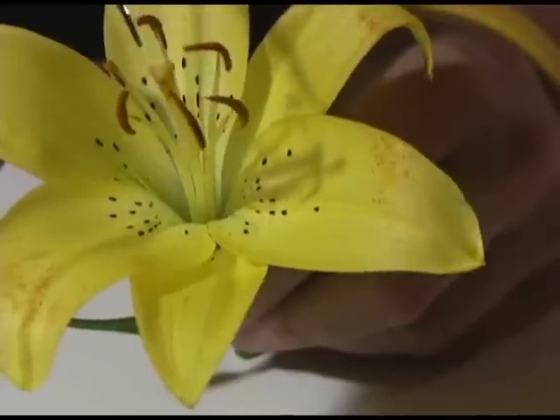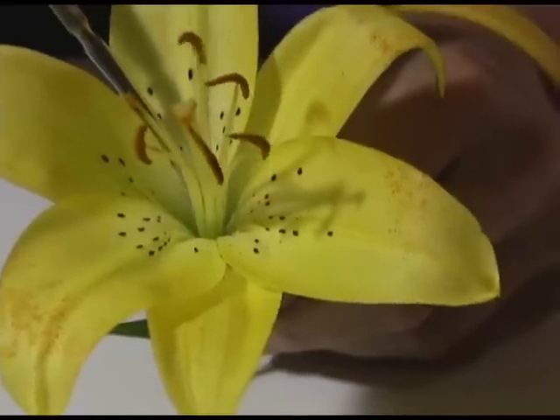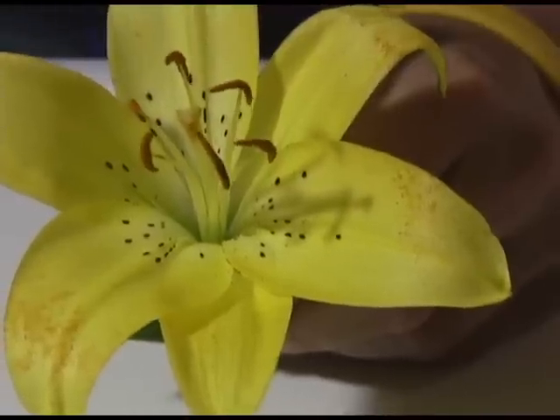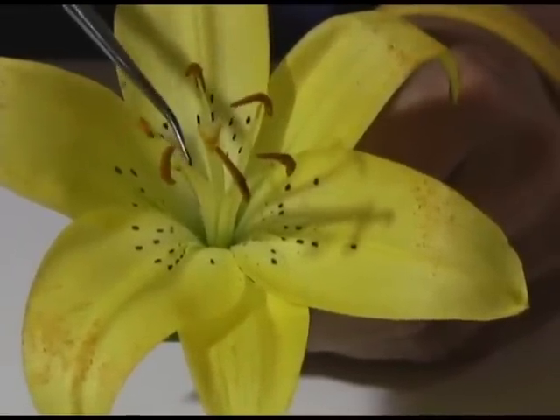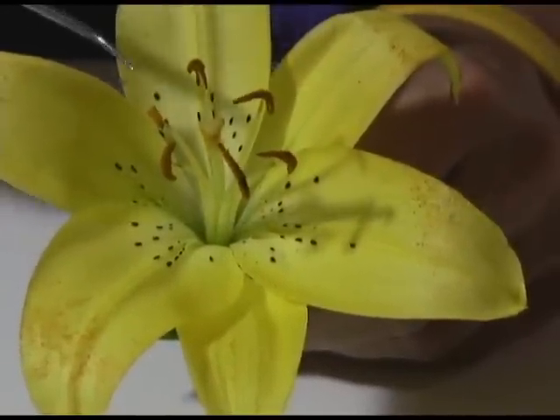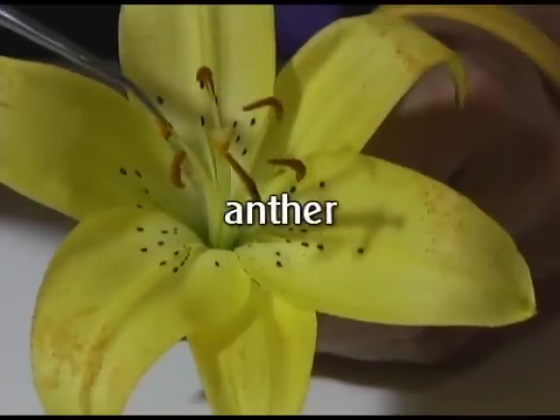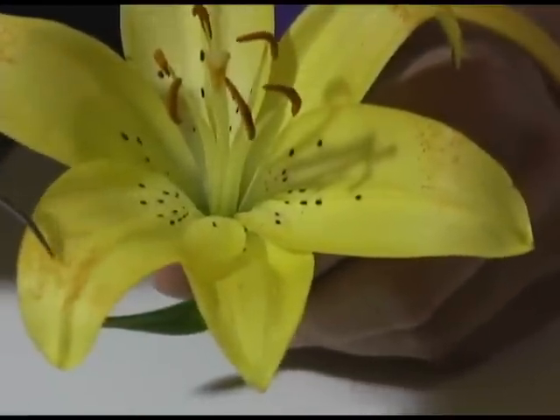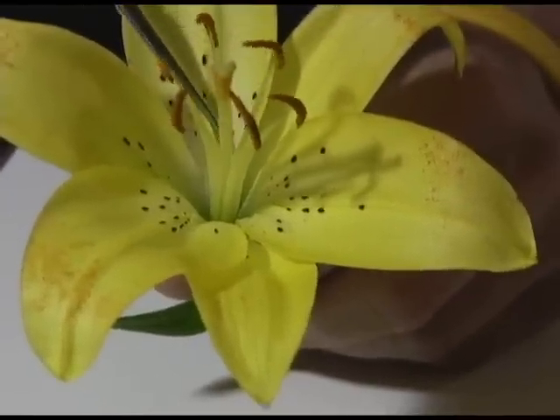So when pollen lands on the stigma and grows down the style, this tube comes down into the ovary and fertilizes the eggs. When the eggs in the ovary are fertilized, they turn into seeds. The male structure of the flower — remember, both sexes are present here — are these structures here, called stamens. It's easy to remember that these are the male structures because they're called stamens — they have the word 'men' in them. The part at the top is called the anther, and this is where the pollen is produced. All this brown stuff on top and some on the petals — this is pollen. It's a very sticky substance, and that's the male sex cell, whereas the female sex cell is in the ovary, and those are the eggs.